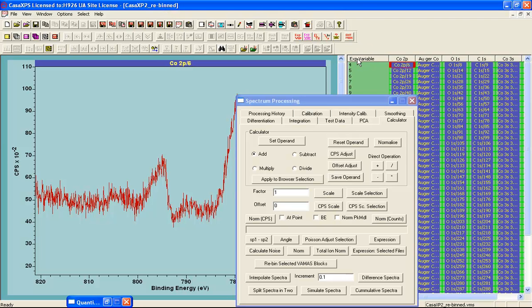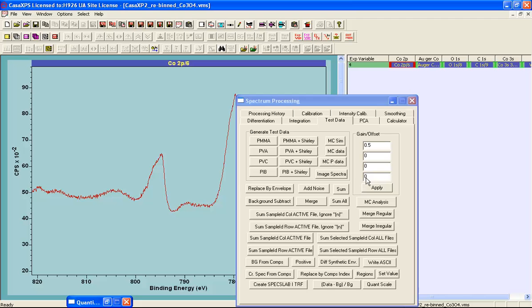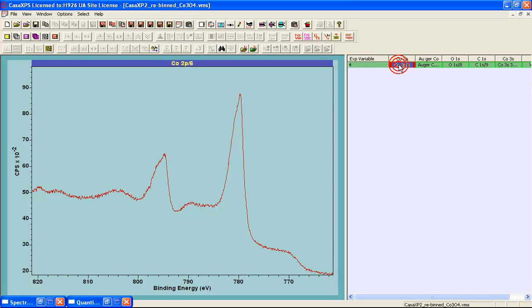And then if I select these, I can then use the test data property page. I can sum selected sample ID column all files. So in this case, I've just got one file selected. And when I press this button, I produce a new VAMAS file that now contains all of these narrow scan spectra that have been summed on the basis of the charge corrected data.